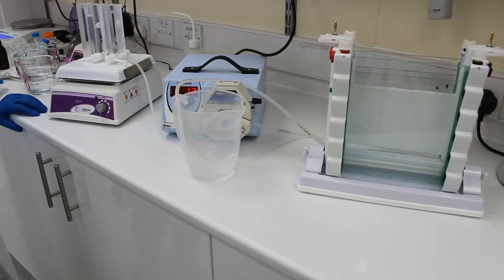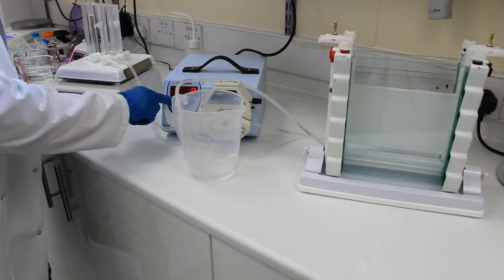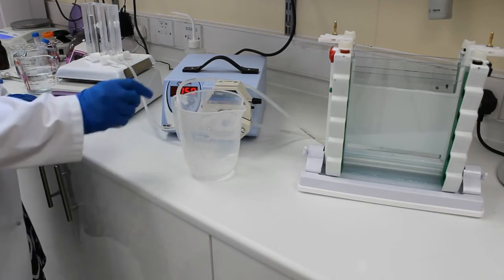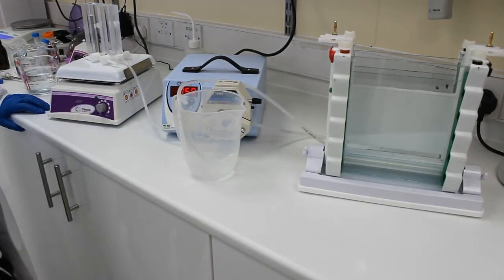To make this go a little bit faster as well we can actually turn the speed up on the peristaltic pump. So that just puts a little bit more pressure on the system and forces the liquid through it.